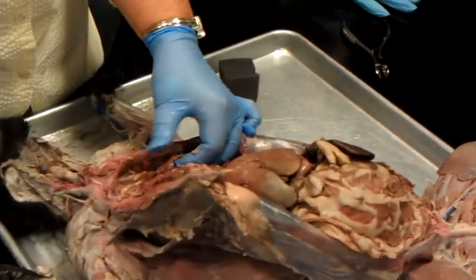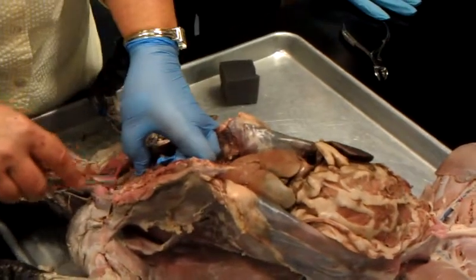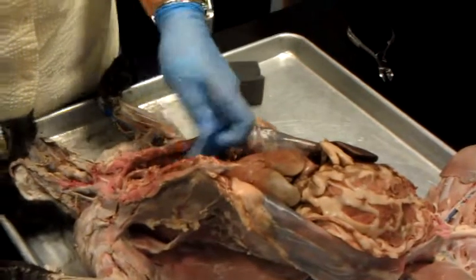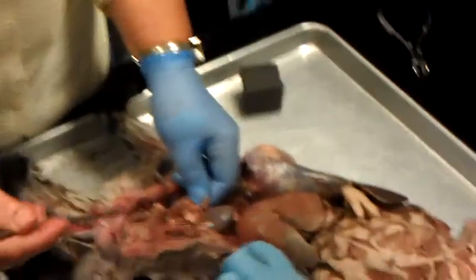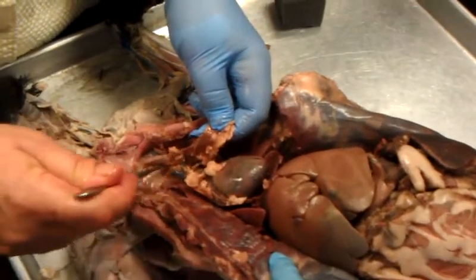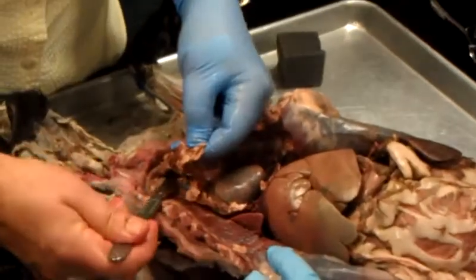Some has to stay. I try to find a thymus gland. This is a fairly young cat. Not a baby, but fairly young. Some of you will not have a thymus gland, but they do. See it right here? It's this soft, smushy stuff right here. So it wraps around the heart and comes up the throat. Awesome. I'd like to lift it, but leave it a little bit attached.